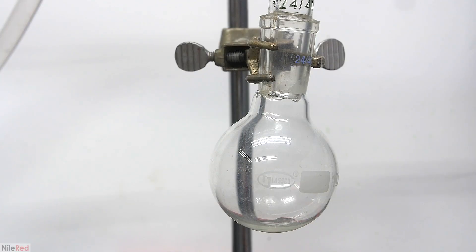Unfortunately, at this time, I didn't have a cow adapter, so I couldn't easily swap the receiving flasks. In some cases, it is possible to re-pressurize the system, swap the flasks, re-pull the vacuum, and continue the distillation, but with benzaldehyde, this really isn't an option.